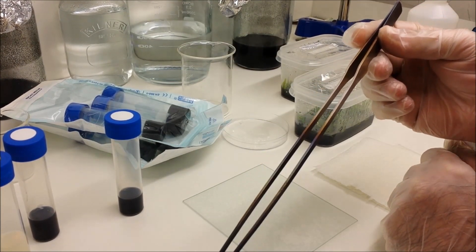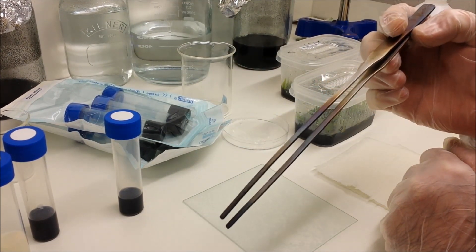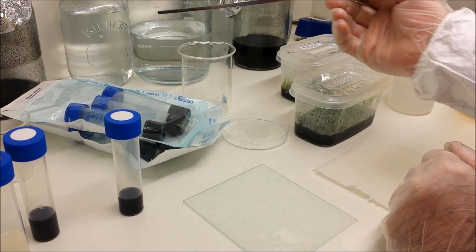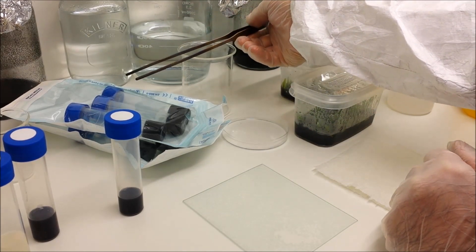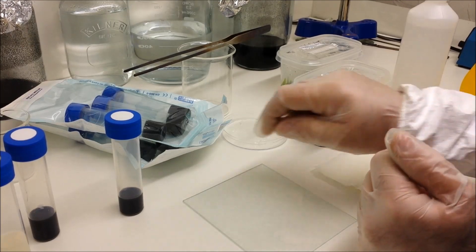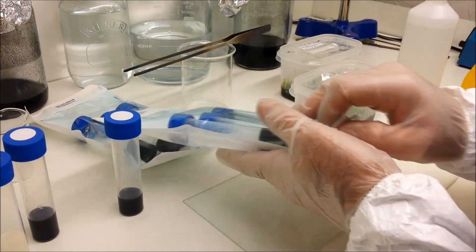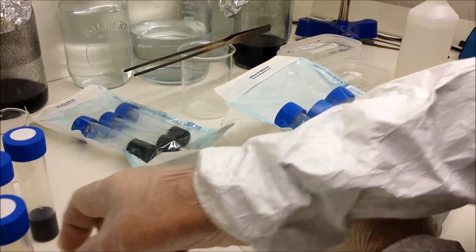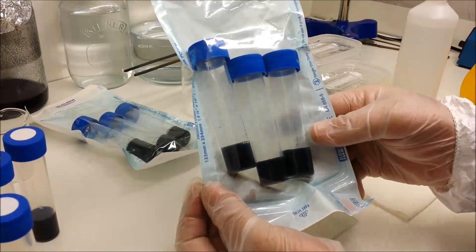Now I've also got a large pair of tweezers—these are quite thin tweezers as you can see—which is also being sterilized. Now they look dark because they've actually been in an incinerator to sterilize them, but you can wipe them with isopropyl alcohol.